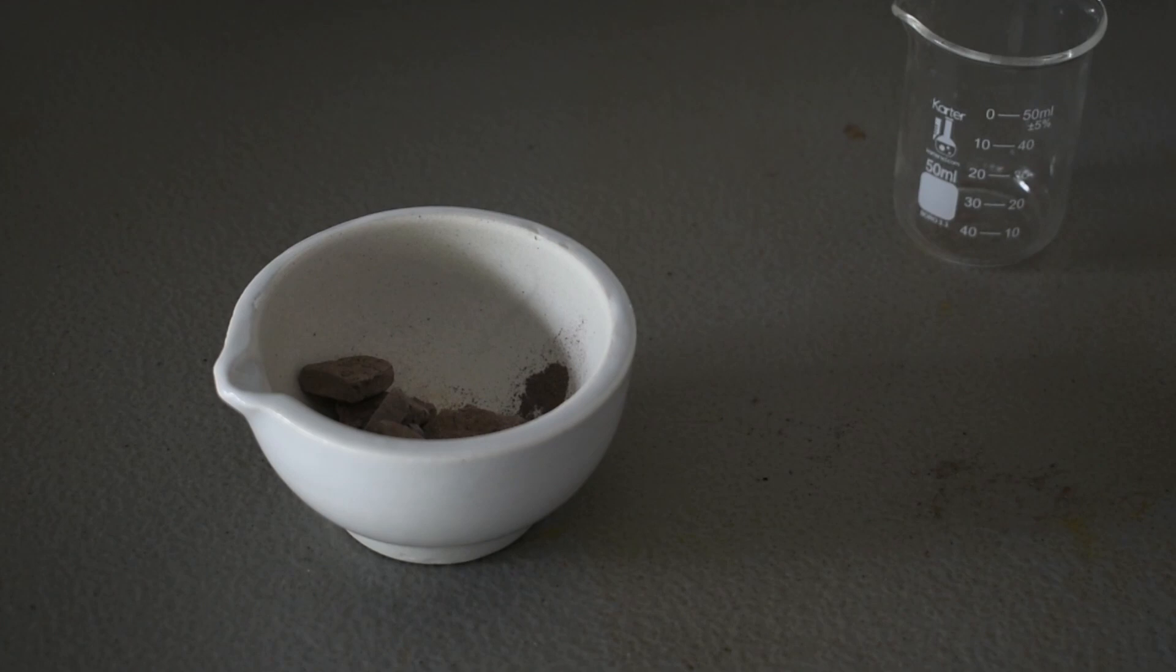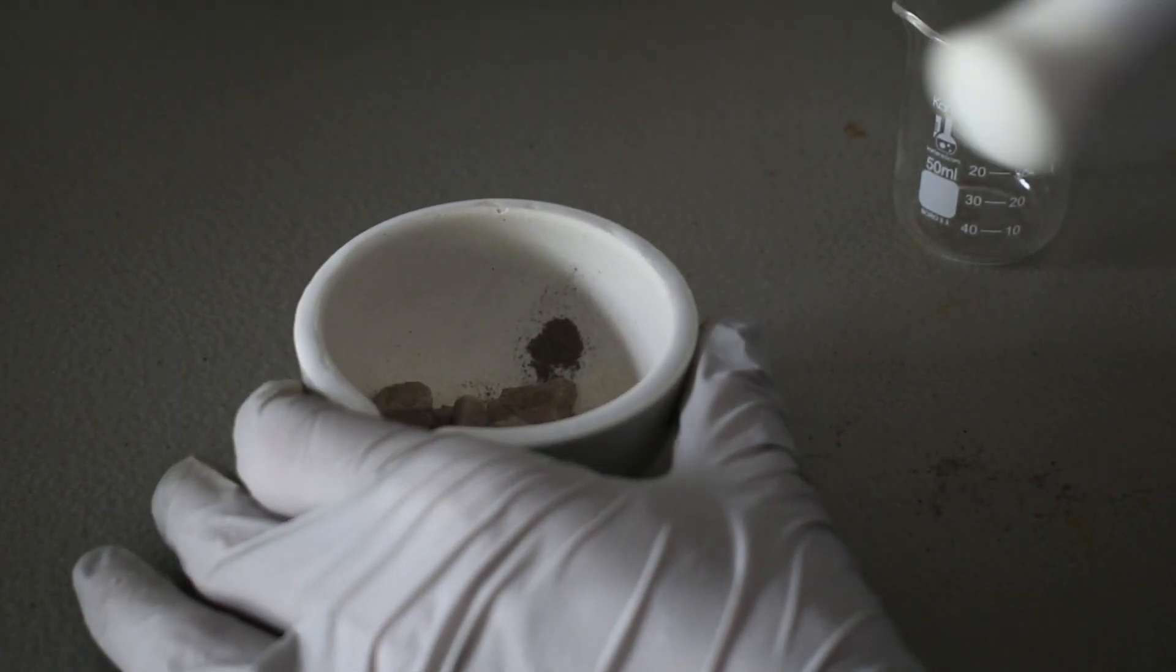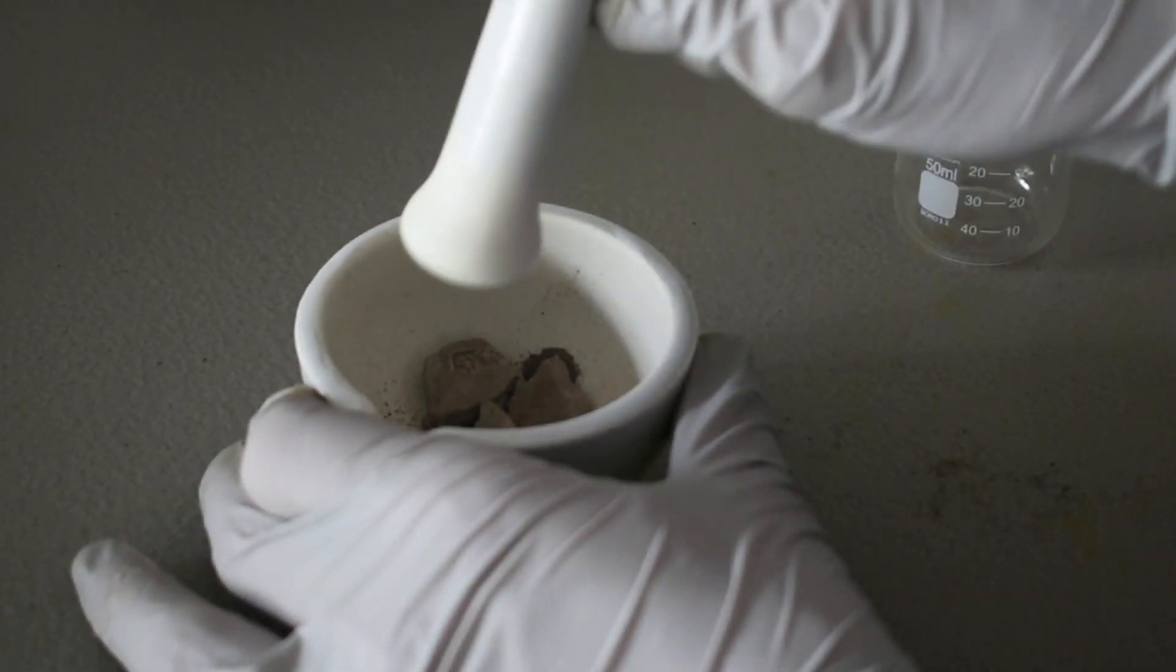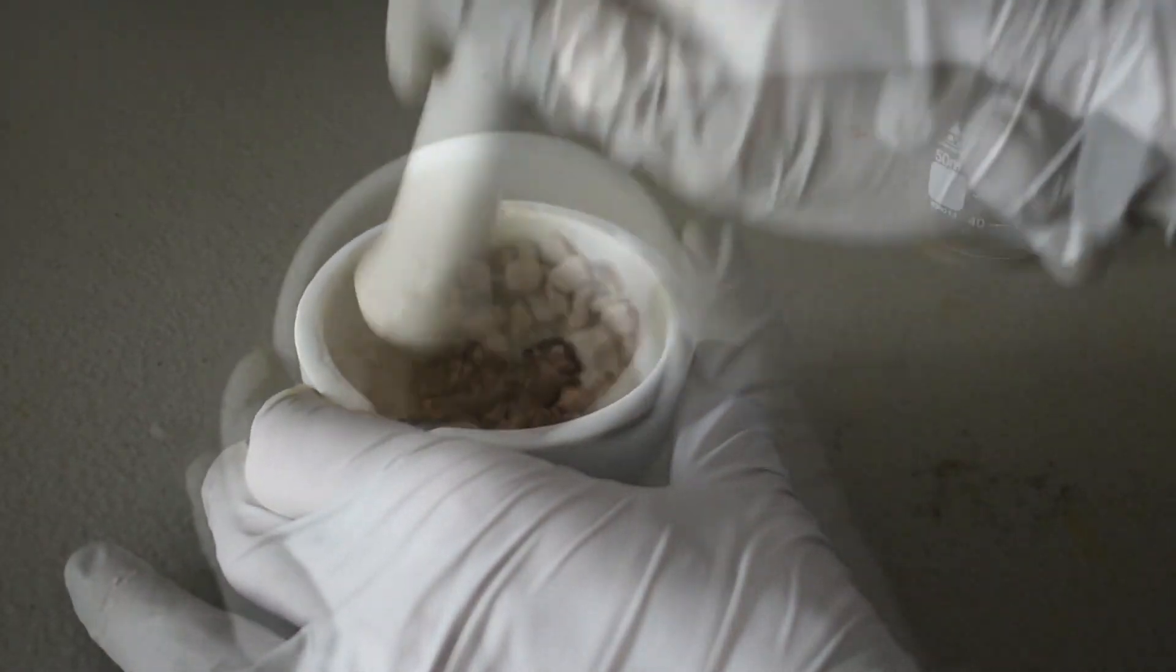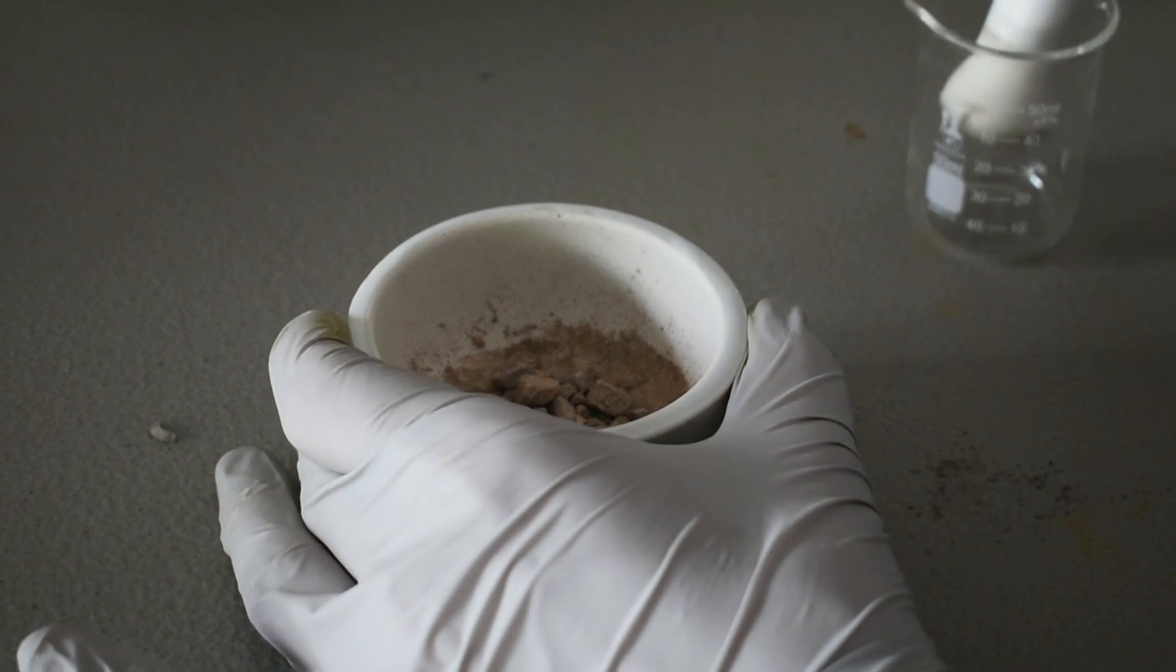And then you distill out the water to yield anhydrous iron 2 chloride. Alright, I feel like that's good enough particle size.